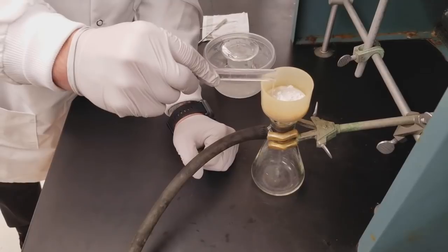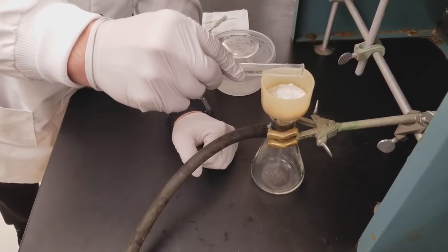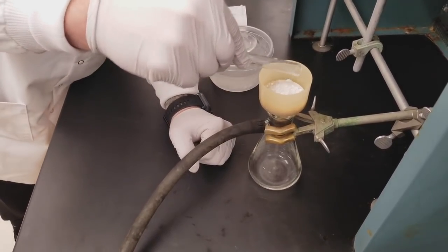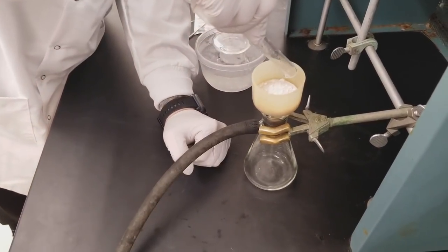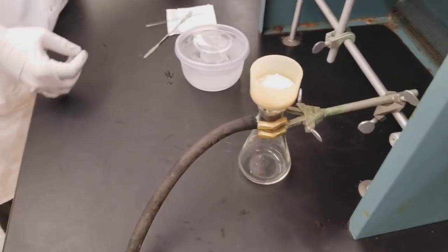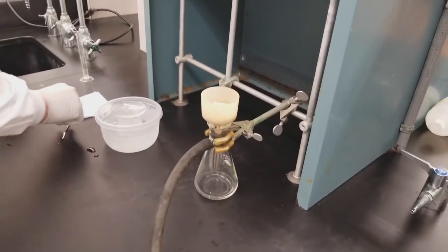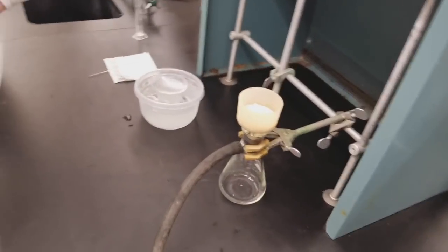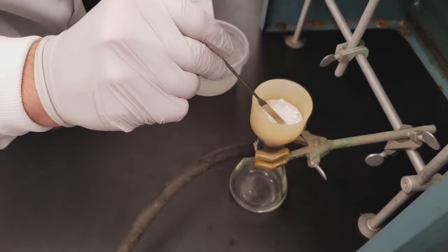And at that point, after you've poured the water over, again you're going to want to take a spatula and spread those crystals out and agitate them. That's going to once again maximize the vacuum that's coming through our crystals to get them dry.